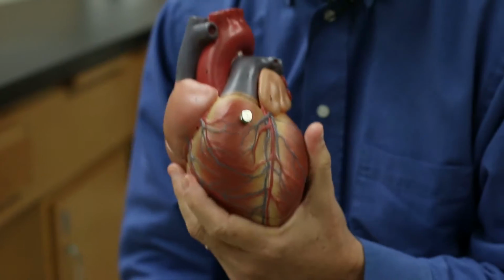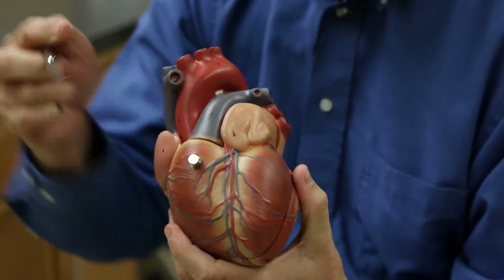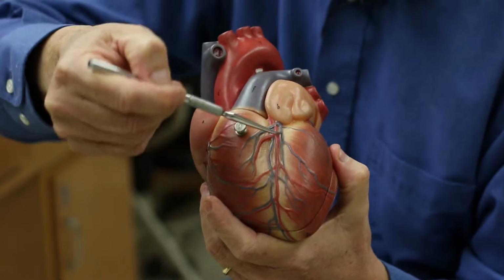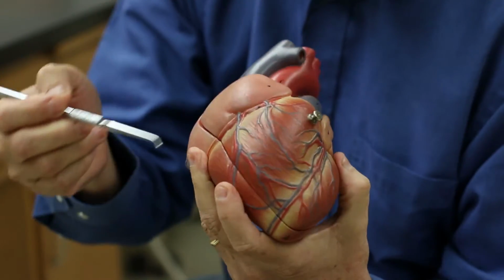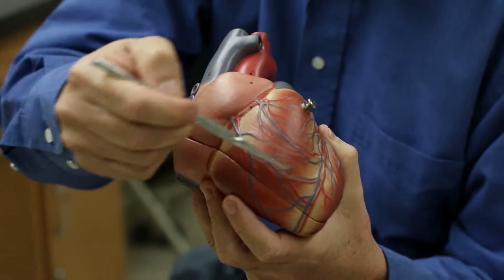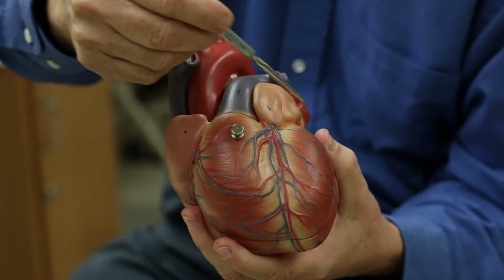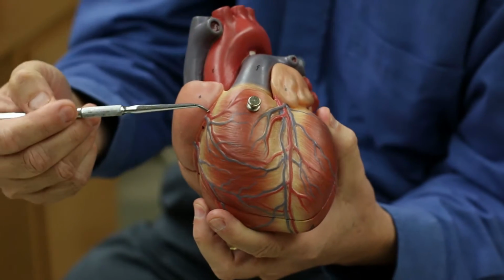Okay, now that gets us to how we're going to cut. There are two ways to do this. We can make small incisions here up to about the septum here, the sulcus on the outside, across here, and cut a small window. And we can do another window on the right side here. The other way to do this is just to make one large cut all the way around at about the border between the ventricle and the atrium, all the way across like this.